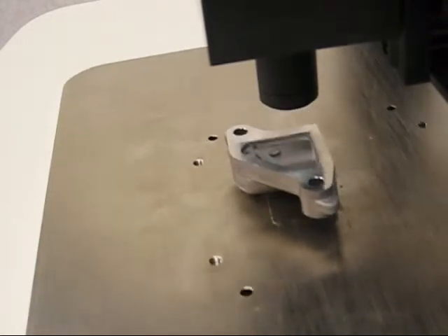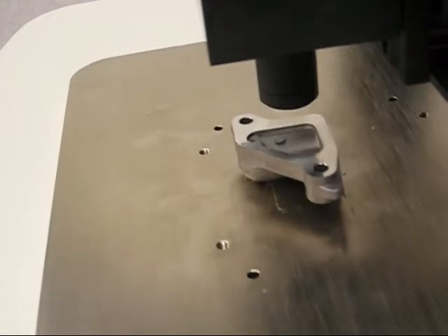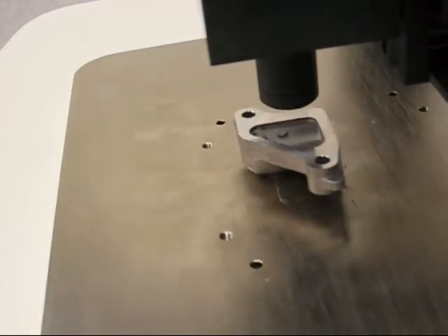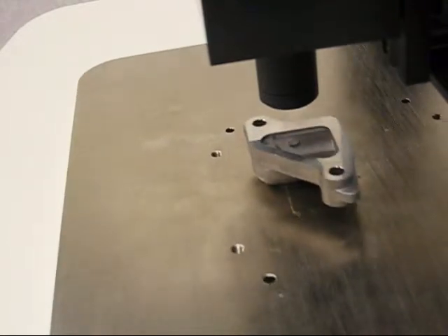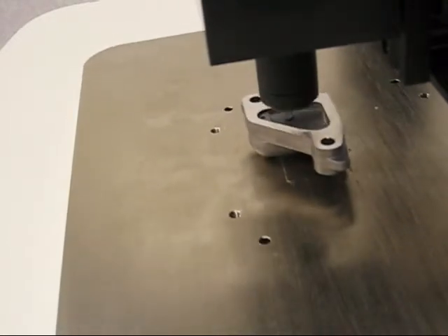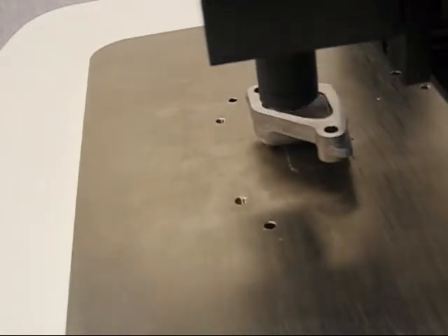The XY table can move 150 millimeters in X and 100 millimeters in Y. The part is placed on the scanning table, and ProScan is programmed to scan the surface with 2 millimeter step size in X and Y, gathering around 1000 measurement points.